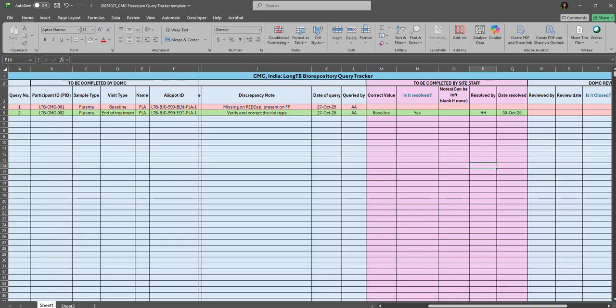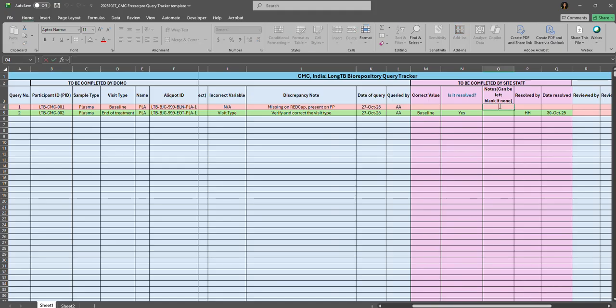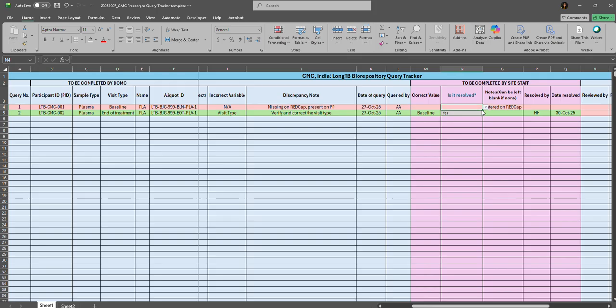For the missing type of query, sites must also indicate if they have entered the data, if they have corrected the data on REDCap, or if they have entered a new sample as suggested on FreezerPro, or where you have corrected the missing sample type. Suppose here this sample type is missing on REDCap but is present on FreezerPro. They have not entered data for the baseline visit for the plasma, so if they have corrected it on REDCap, they must indicate entered on REDCap, respond yes here, and enter the initials and the date it was corrected.